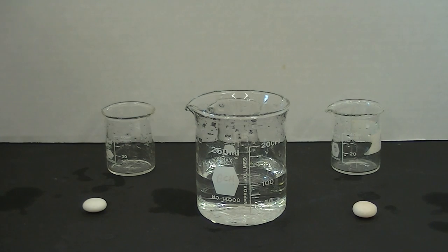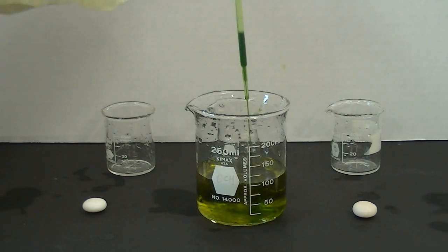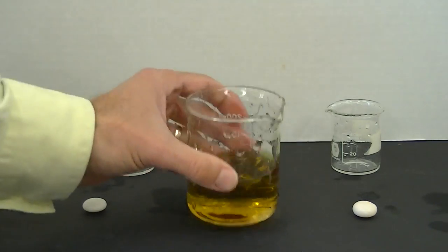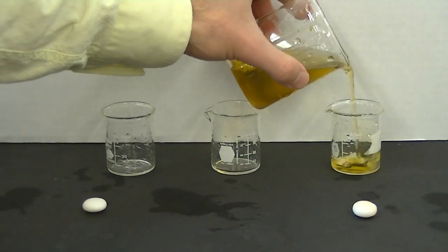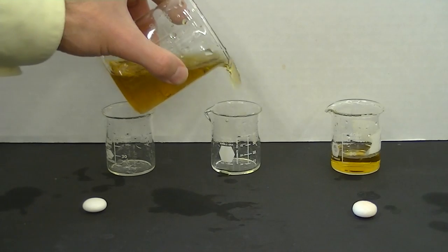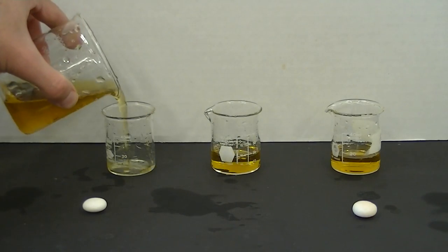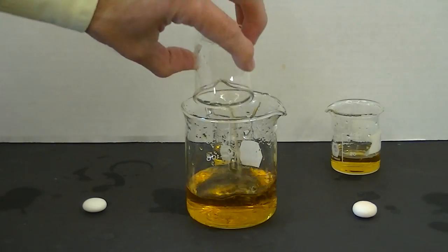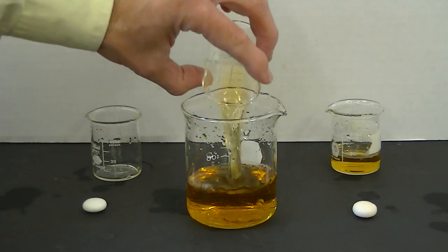I'm going to add a squirt of Universal Indicator to about a hundred milliliters of water and I'm going to pour it into three separate beakers, just to show that there's nothing in these beakers and I'm really using the same fluid for all three experiments.